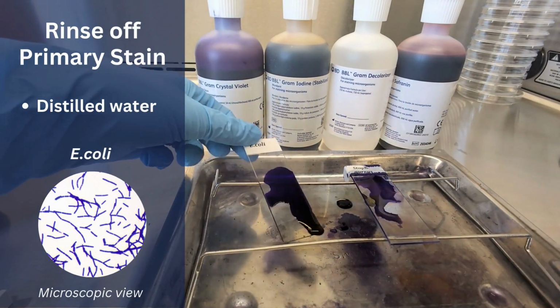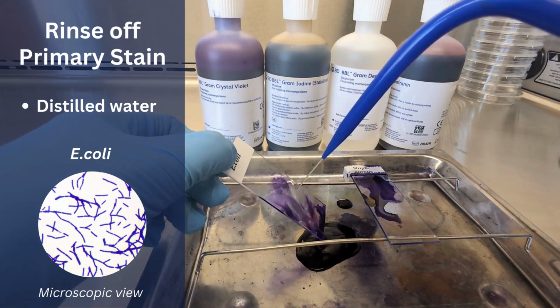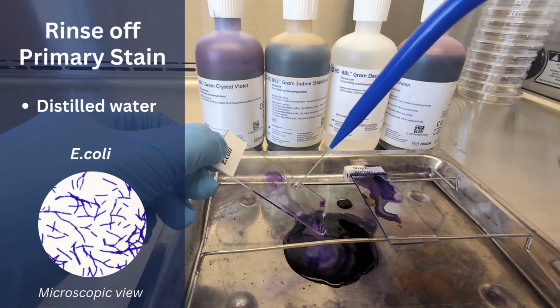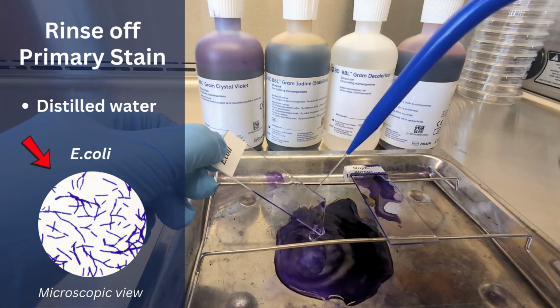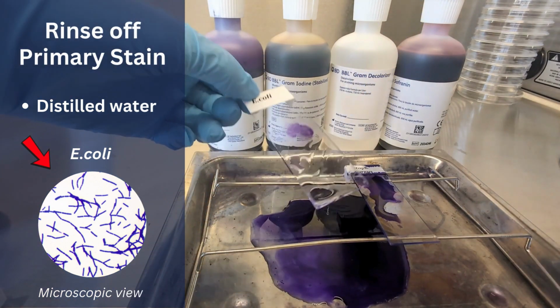Once the crystal violet has been on the slide for about 2 minutes, we gently rinse it off with distilled water. Included is a microscopic view of the bacteria and what it might look like at this stage after the primary stain has been applied.